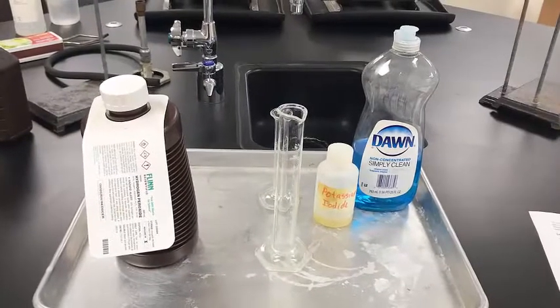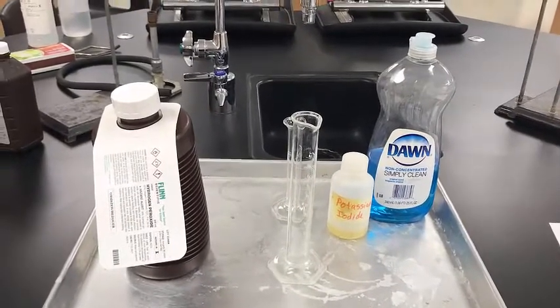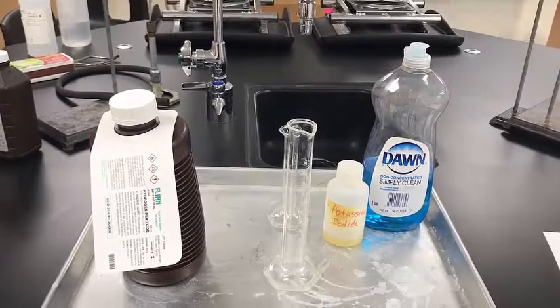Today we're going to be looking at the types of chemical reactions lab. For this you're going to need to have the file open. You can print it out if you have that capability. Otherwise you can just fill it out as you watch this video. I'm going to do the labs in order following along on the sheet, and you can just fill in and answer the questions as we go. Okay? All right. So for our first lab, we're going to be looking at the decomposition of hydrogen peroxide.